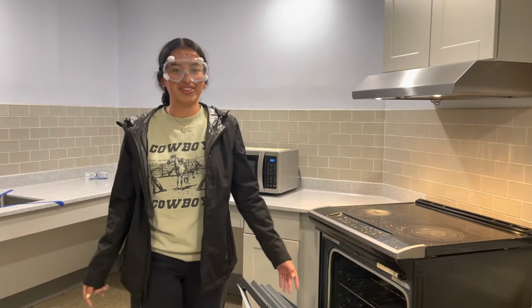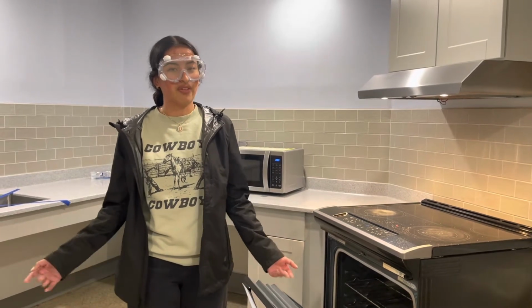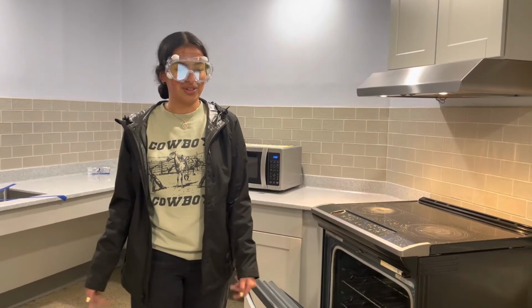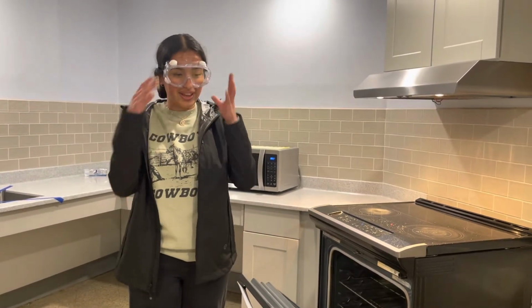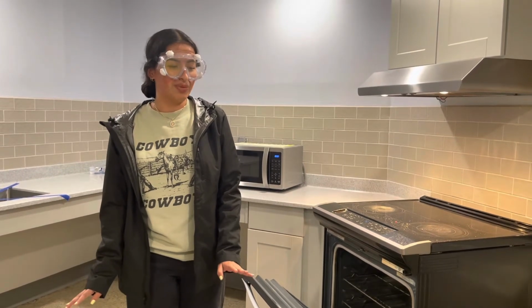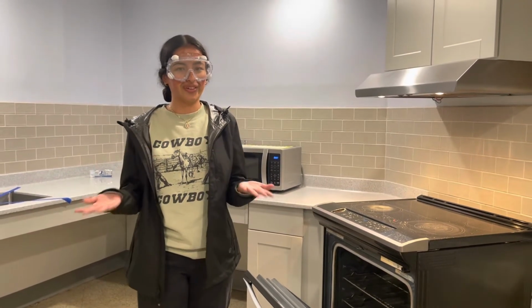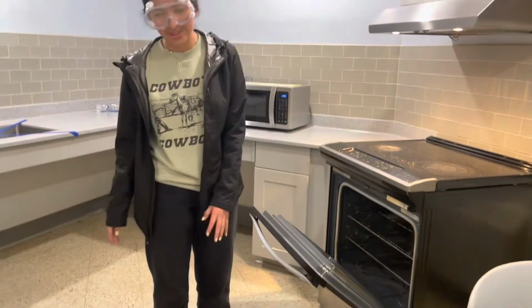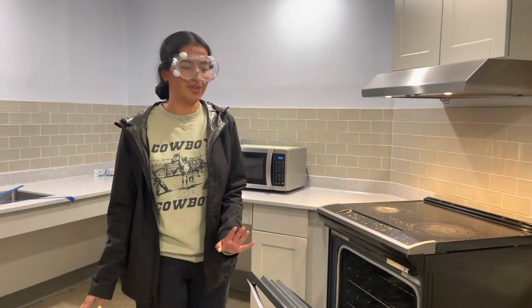Speaking of which, when doing titrations, make sure you wear full PPE no matter what reactants you're using. That includes goggles, a lab coat, and gloves. I am not wearing full PPE, have no gloves, and no rubber-soled shoes, which is not what you're supposed to do.